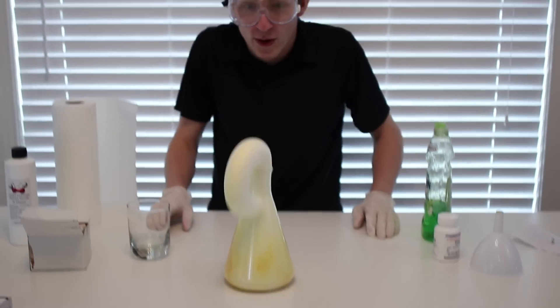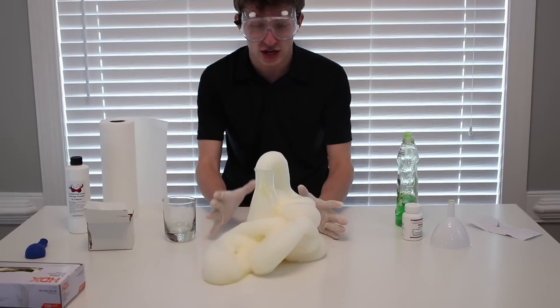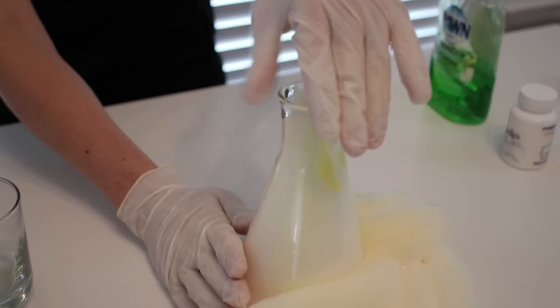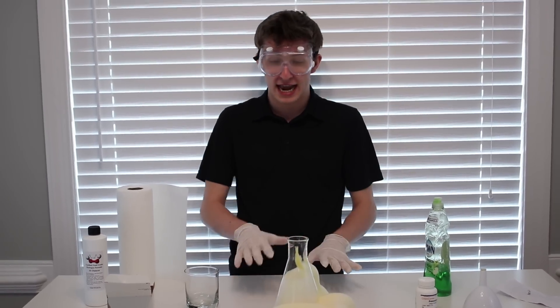Okay. I'm digging it. So that's what's happening, guys. Oh my, you can see the steam coming off. Oh man, that's so hot. Wow. That is incredibly hot, guys. So that's what happens with just that much of a little reaction. That was barely any whatsoever.